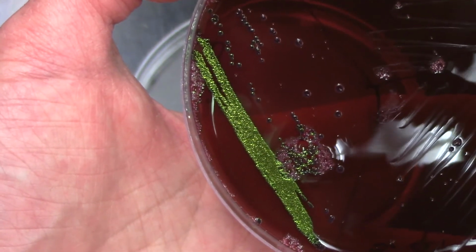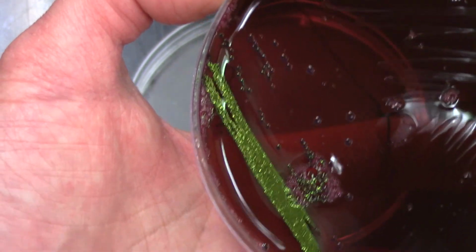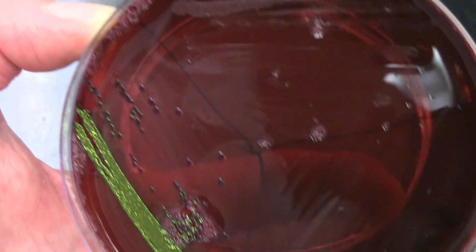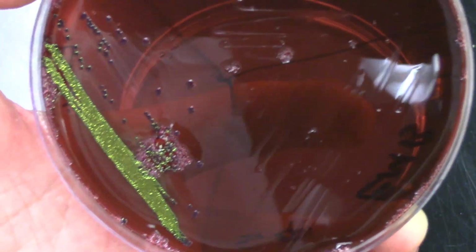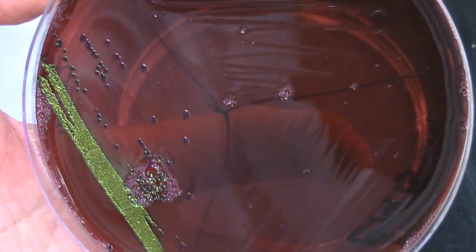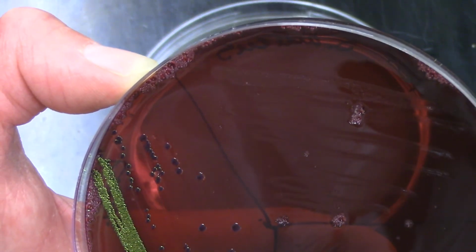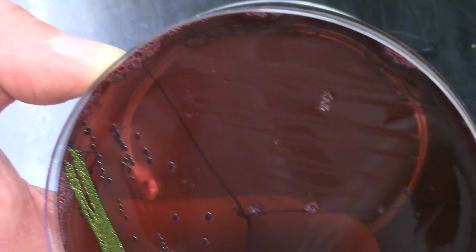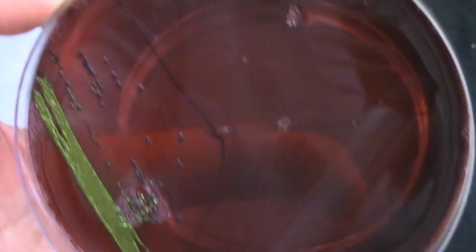If we had another gram-negative organism that was not going to ferment to produce those acidic byproducts, you would see that it wouldn't have that iridescent sheen. But this media is also selective. So when we pan over to our sections where Staph aureus or Staph epidermidis were streaked out, you don't see any growth. There's a little haze there for that gram-positive organism, but it's mostly probably just from the initial inoculation. It's really not growing there.